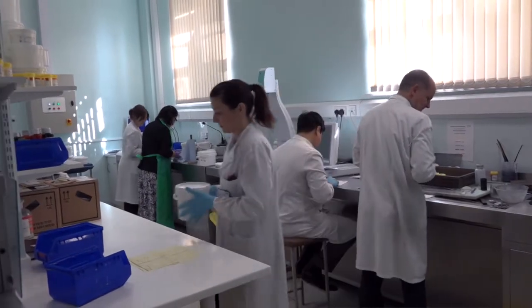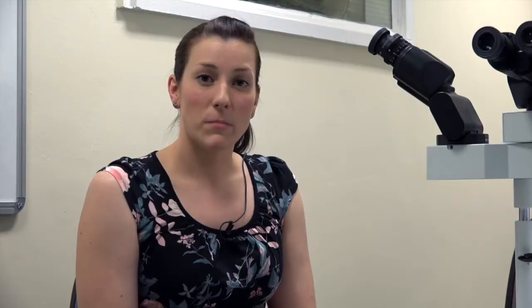Here in the trimming room, either a specialist biomedical scientist or a consultant will come in to dissect the specimens if required, and this means taking a large specimen and selecting smaller parts of it to be analyzed.